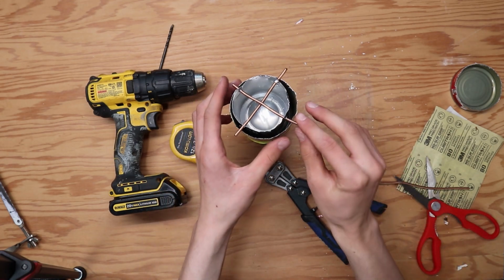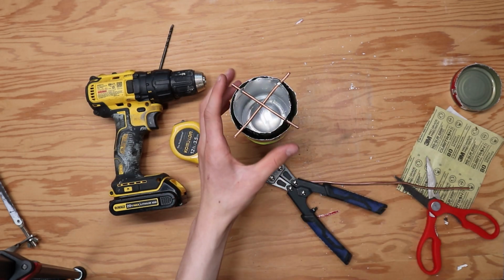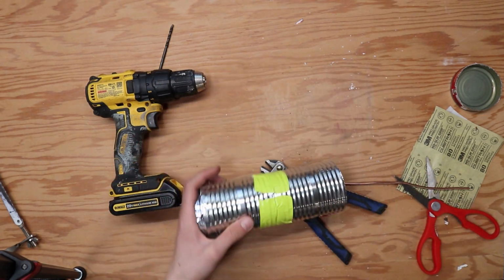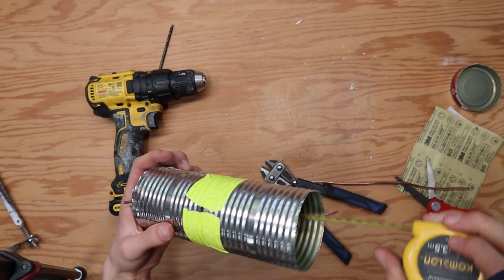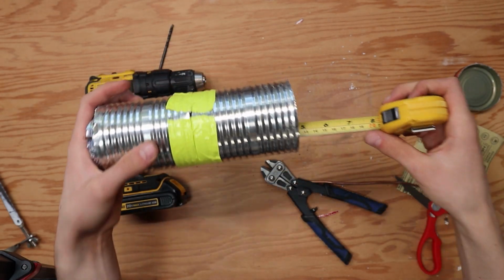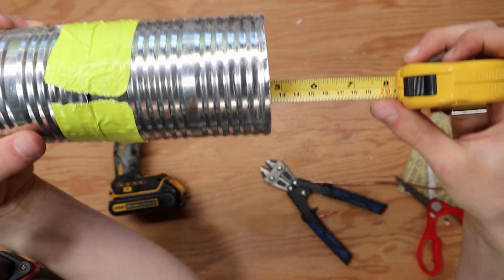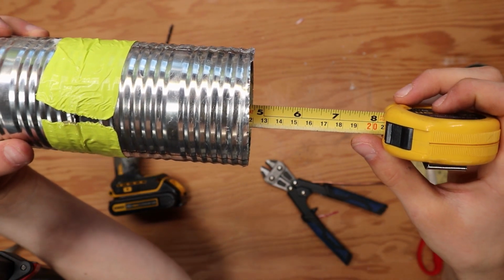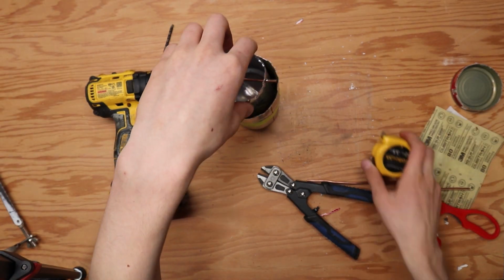This next step isn't technically necessary, but it makes it more accurate with national and international standards. Measure in centimeters the distance from the bottom of the top can to the bottom of the bottom can. I got about 12 centimeters. When you burn a piece of food, it needs to be about 4 centimeters under your top can, and so in this case, I need to make my piece of wire that's going to hold the food 8 centimeters long.